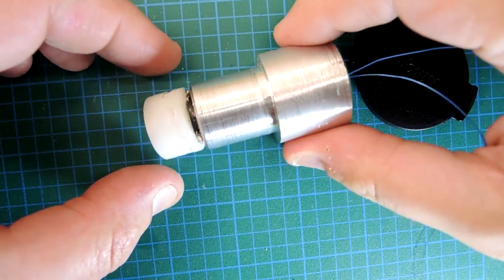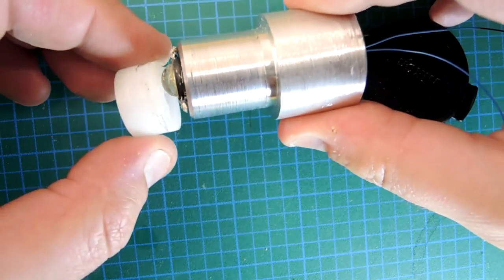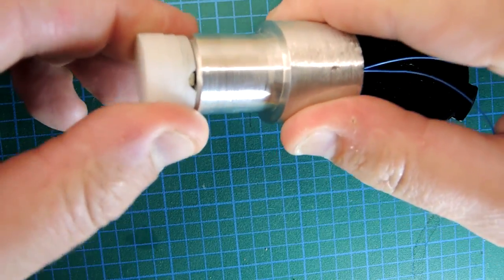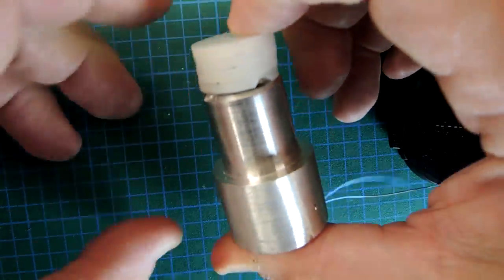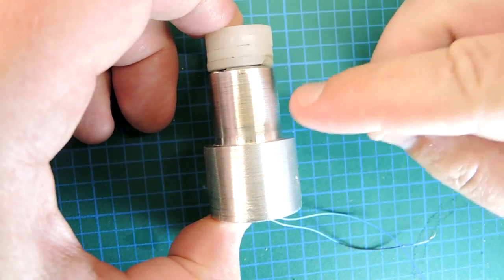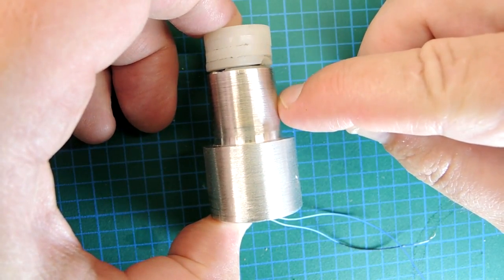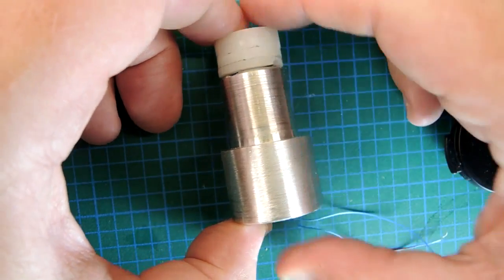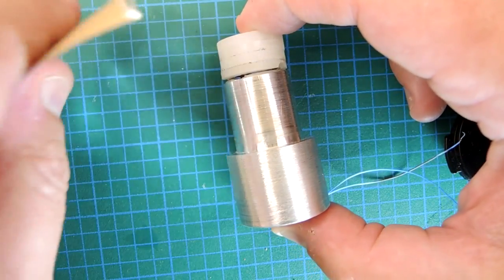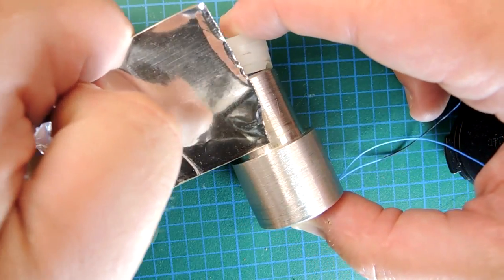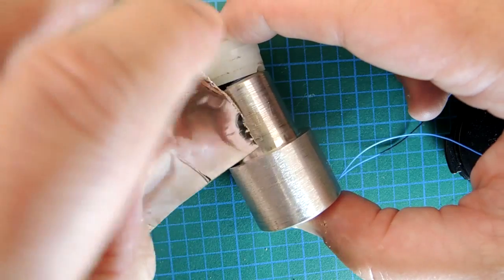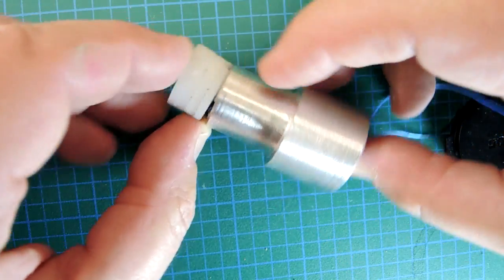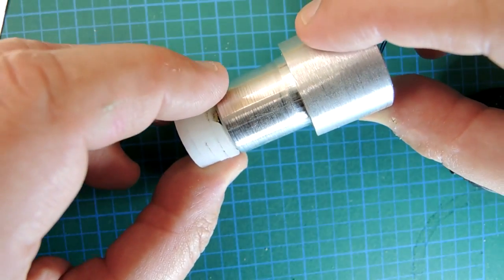So just before I slide it into the eyepiece you can see they're two separate pieces. What I need to do is attach them together. I decided just to tape them. I turned down the shoulder in the eyepiece just slightly, it's too small, basically the thickness of some metal tape and that should give me a nice firm fit. So I'll rotate that around the cylinder here and then put it into the eyepiece.